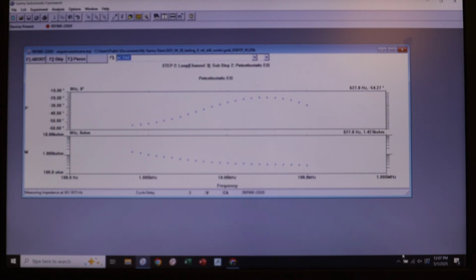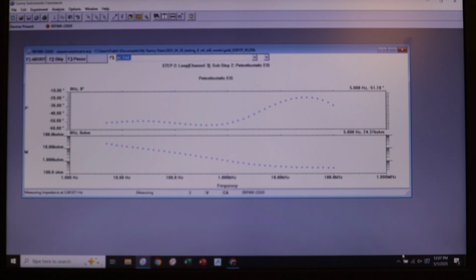And so we can see here we've just gone through channels 1 and 2, and now channel 3 is flying by with amazing results and very clean data. So the reference electrode was our issue of today.